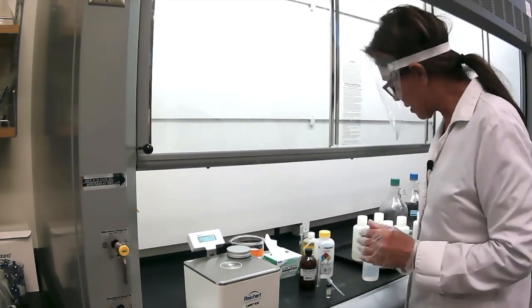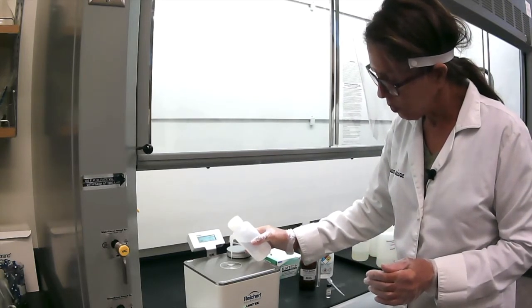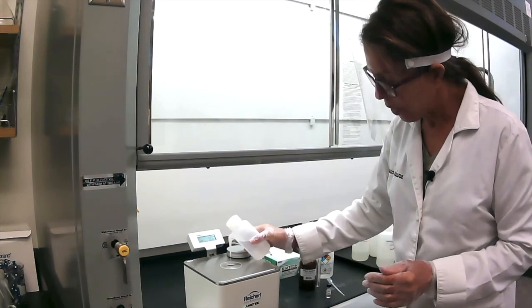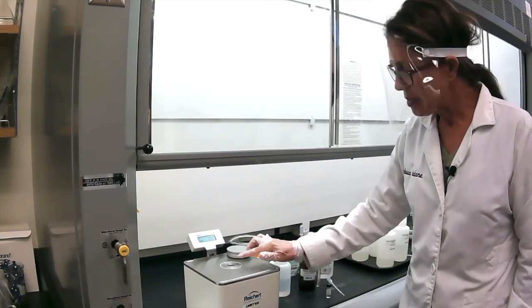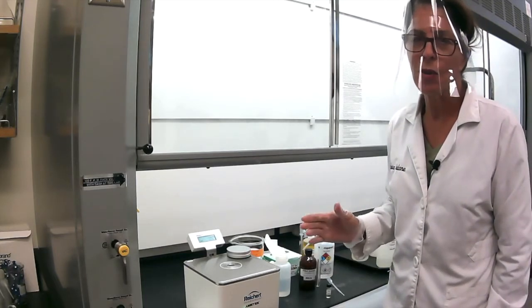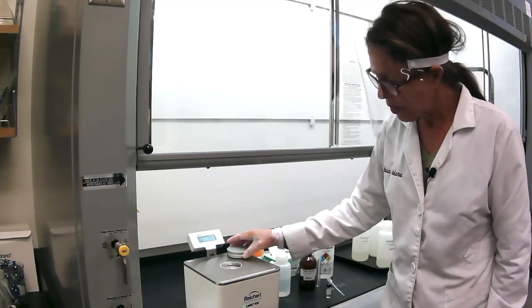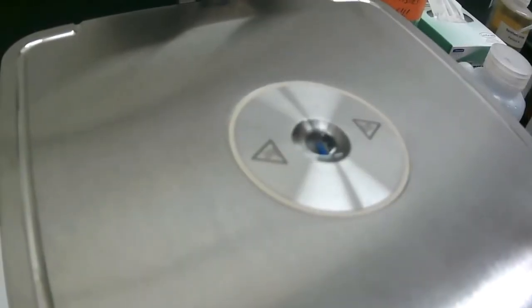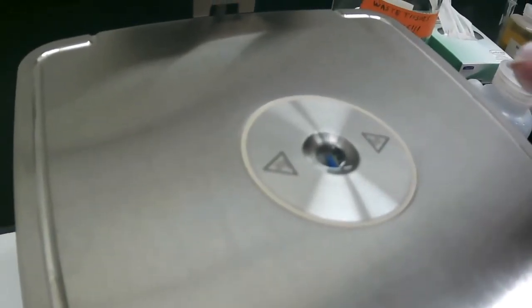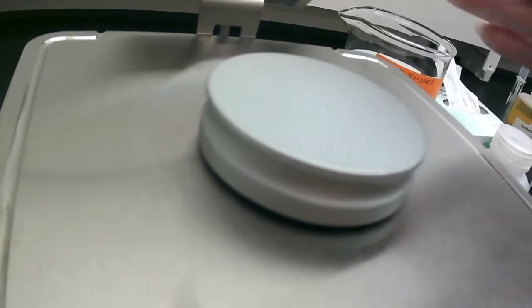Once your surface is clean, you have to fill this little hole with your liquid. We're going to start with water. You have to fill it all the way to the rim. Even if the procedure says put 20 drops, I would just go all the way and fill it to the rim, and then you cover it. So you see here, that's how much you want to fill it up with water. You really want to go to the brim, completely filled. And then you cover it with the puck. I call it a pug.